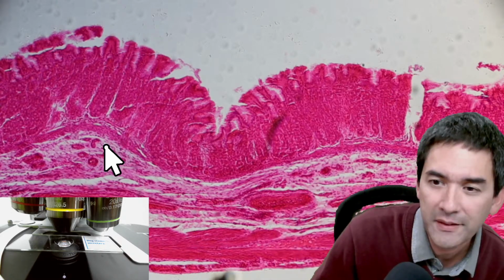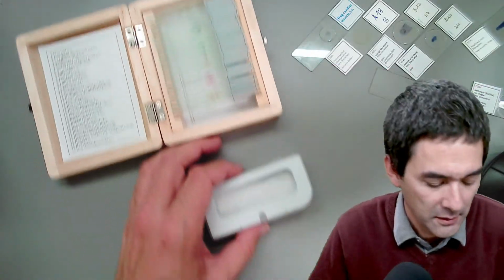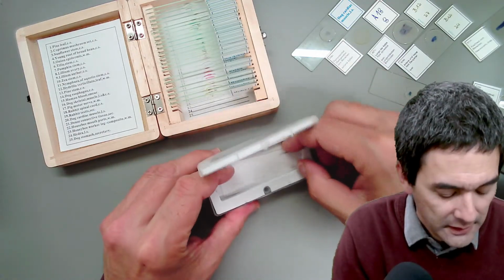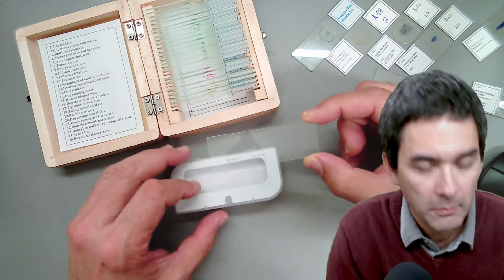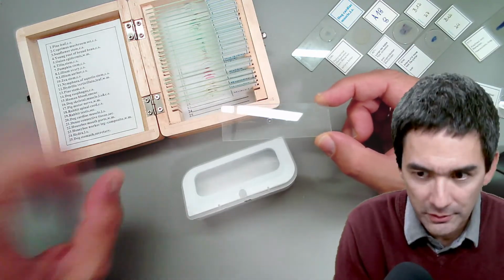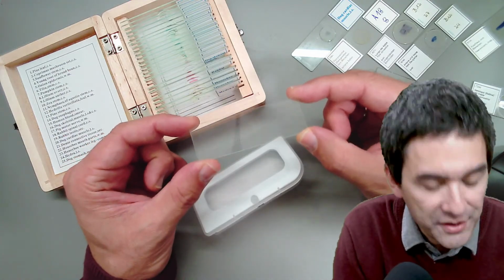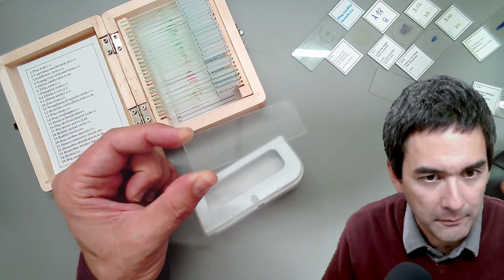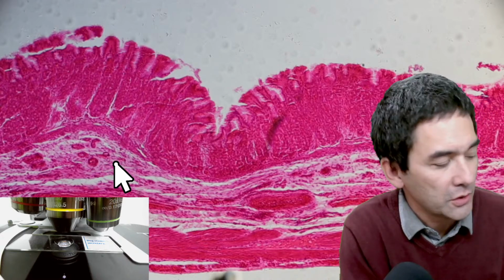I just want to show you something else, because this question with the micrometers comes repeatedly. Look what I got here. This is not an ocular micrometer, but it's a micrometer slide that I bought. And just because there was a question, let's look at the spinal cord. I hope you don't remind me, but I just want to show this to you here, very briefly, because this might also be useful. Okay, so just going to put this in here.